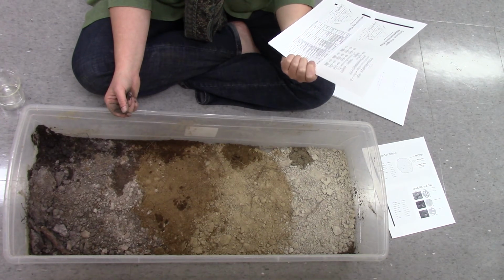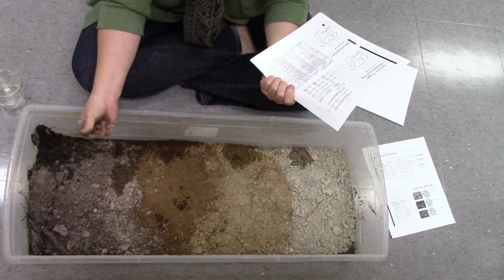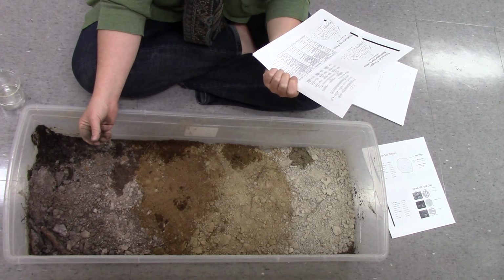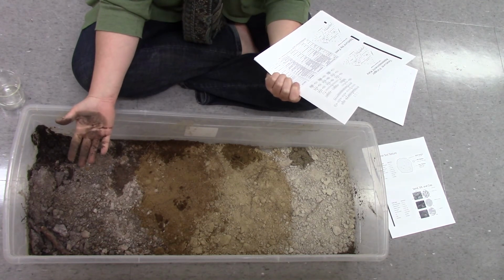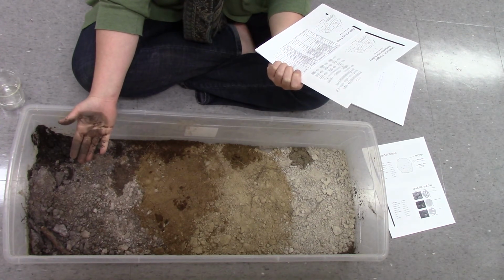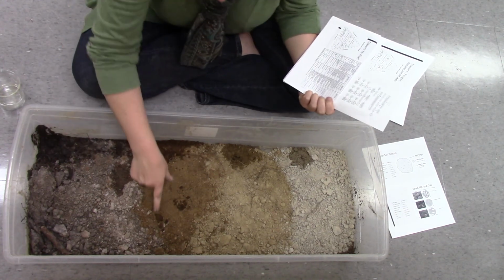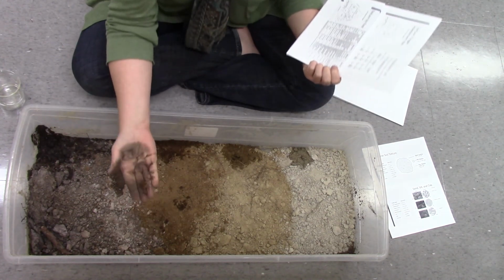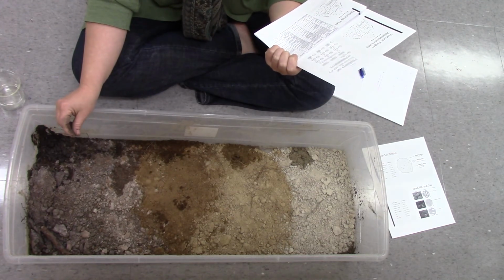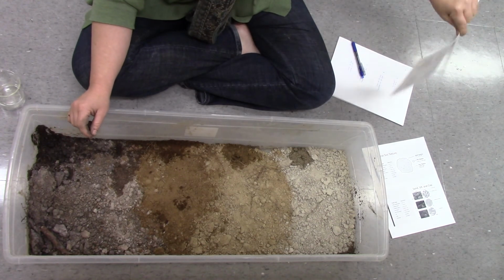And sandy loam: grainy with a moderate amount of floury material. That feels about right. Weak cast, allows careful handling. Yeah, it barely formed a ribbon. You could see how it started, but then it would just flake off into these flat pieces. So that's texture.